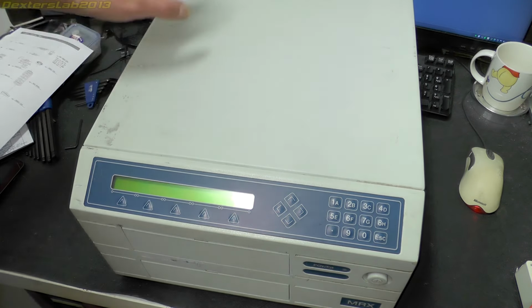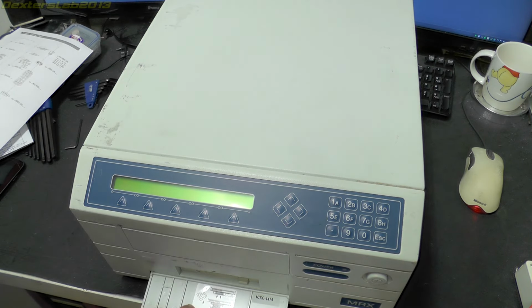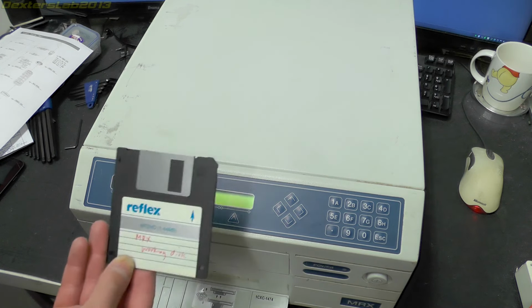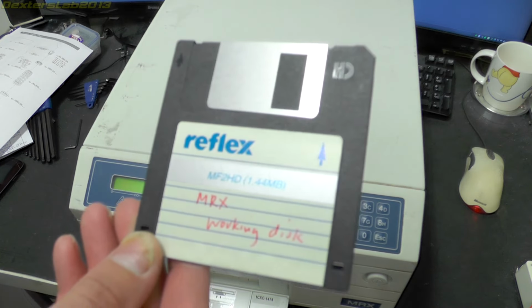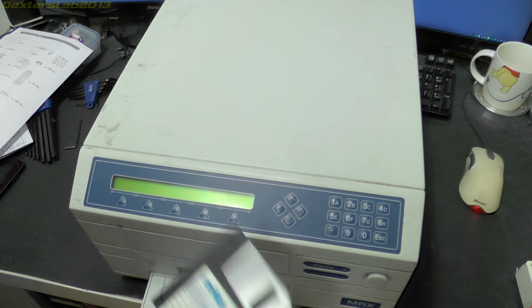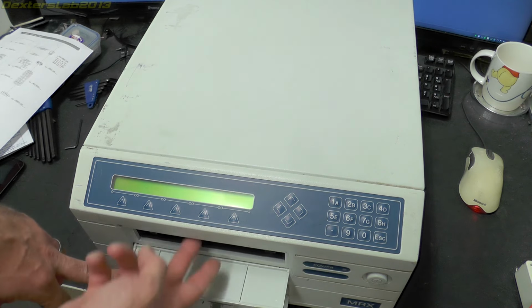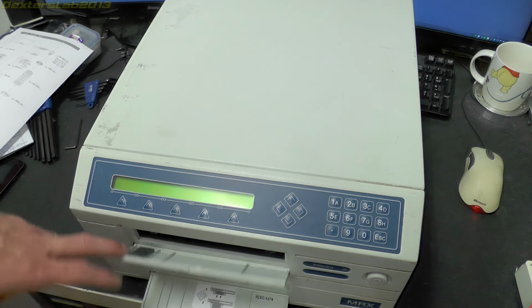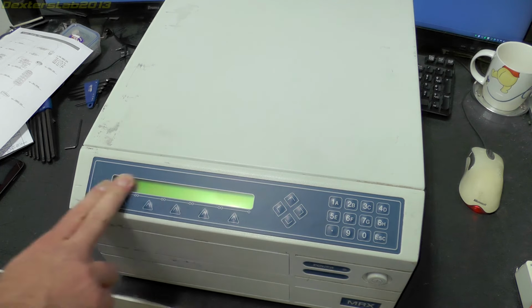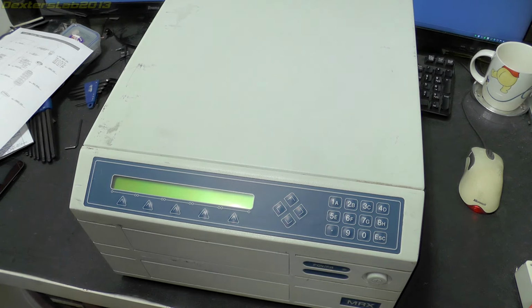So the actual unit itself is a metal box, got a plastic front on here. Got a couple of little doors in the front, one of which has a 3.5-inch floppy disk, and we have MRX working disk, so obviously runs off floppy. That came with it. In the top drawer we have the microplate reader cassette that you put the microplate into, and then it sucks it inside. And just got a basic LCD display with a few keypad buttons, on-off switch on the front, very basic power light, and then a few bits around on the back.